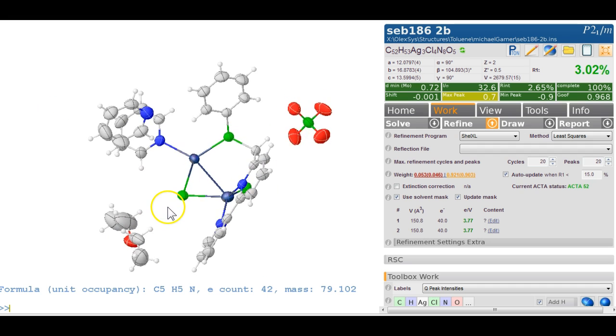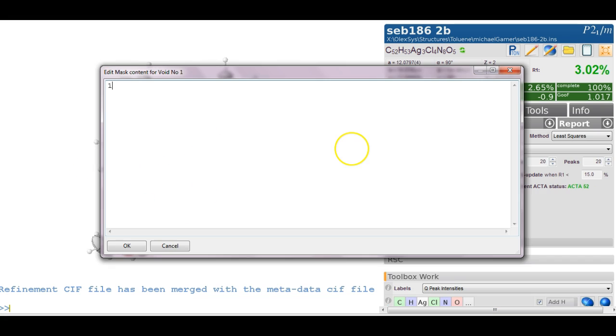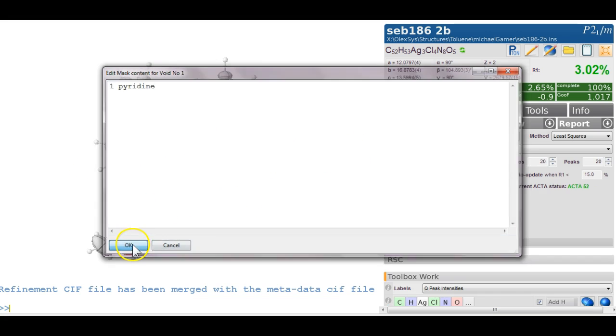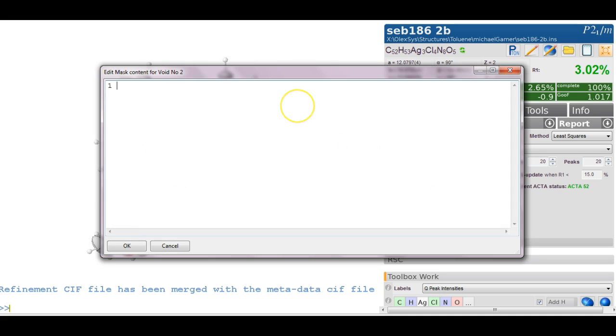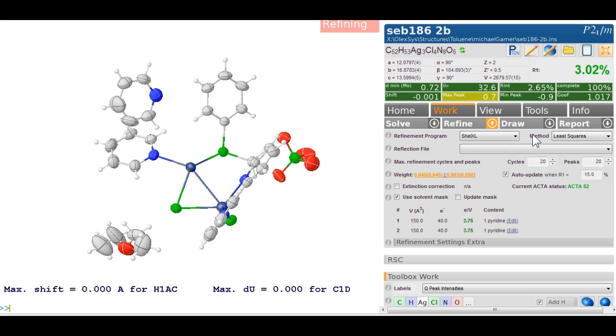So I would probably advocate to use a form of SQUEEZE, or our own version here, SQUASH. Make sure this is all settled, refine this again, and what I've done is still updating the mask this time. So the next round I'm going to no longer update the mask, and now it's going to use the mask that you calculated in the last round. And now I can write in that these 40 electrons are 1 pyridine. And I can do the same in this one here, 1 pyridine, and this will now stick. If I refine this again, it goes through to the CIF file, where I will show this in a second.